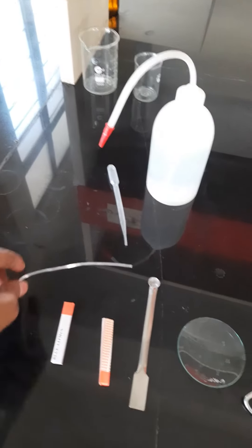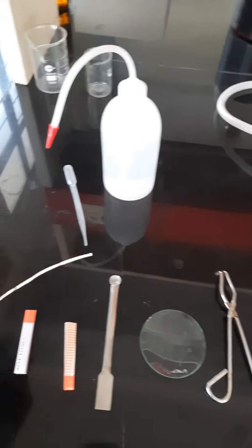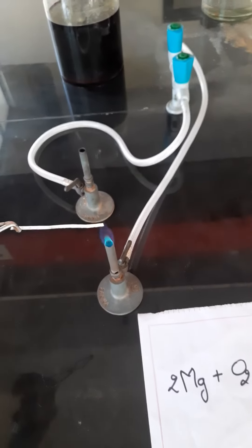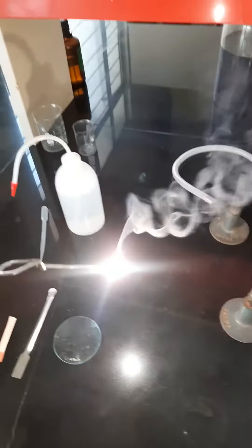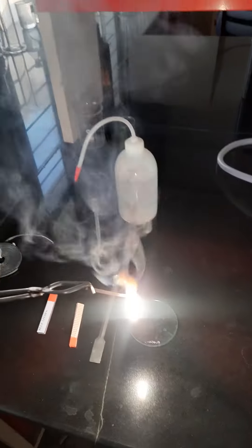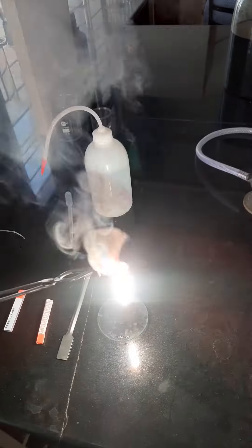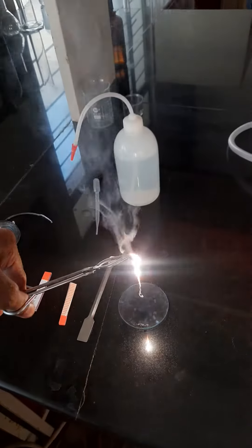So let's start the experiment: if magnesium burns with oxygen, what reactions will happen? This magnesium ribbon will burn with a very large flame. It will be very difficult to see it. Look at this — white color fume is being released.